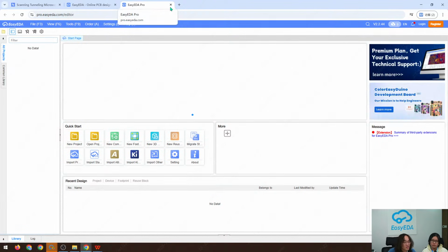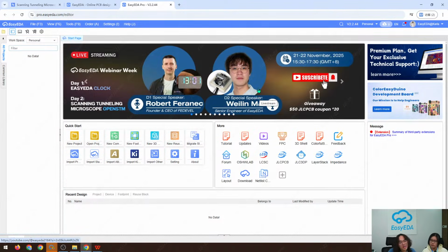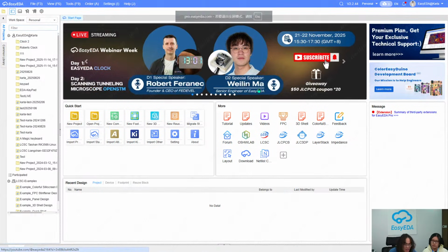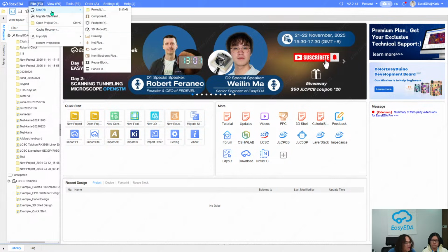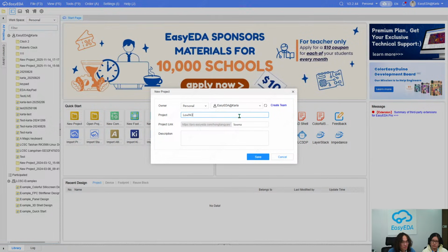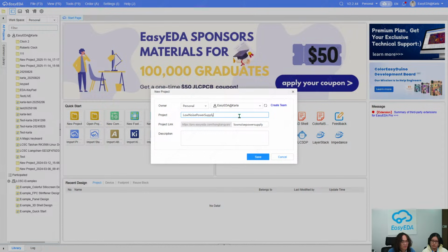So when EasyEDA releases some update, you don't need to install the update on your own computer. You just open the browser and the update will automatically come to you. So here we can click File, New to create a new project. Let's say low noise power supply, and maybe you can add some description.